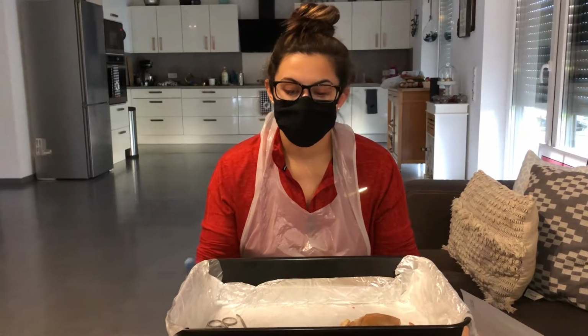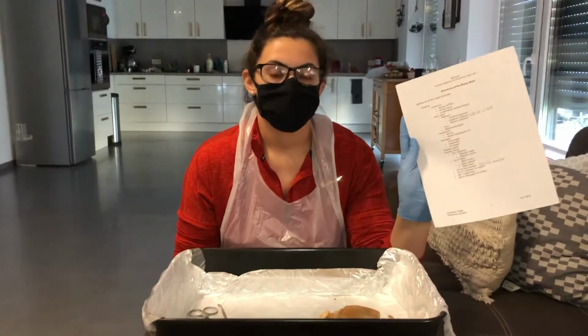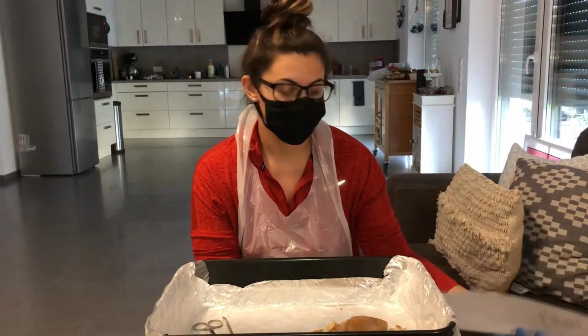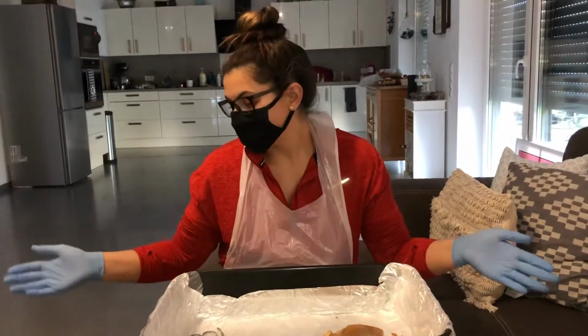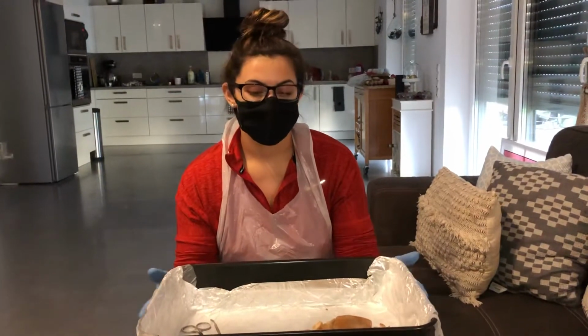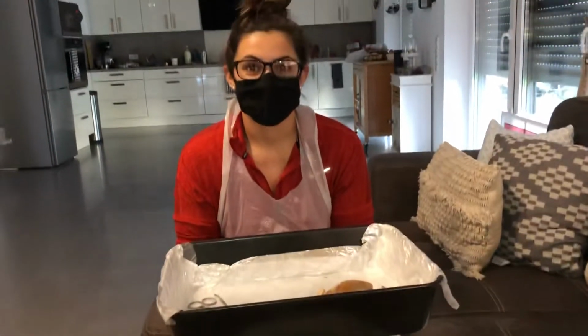This here is my sheep brain dissection. As you can see, this is a list of structures that I'm identifying. There's nothing else on the paper other than how to pronounce the words. This is my workspace. I'm about to move, so as you can see, I don't have a dining room table, so this is a sufficient amount of space for my project today.